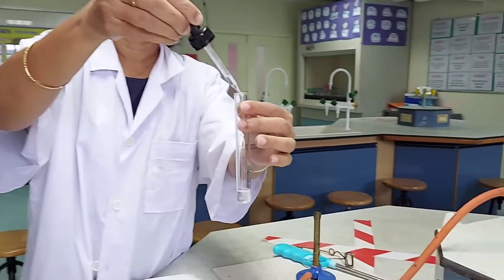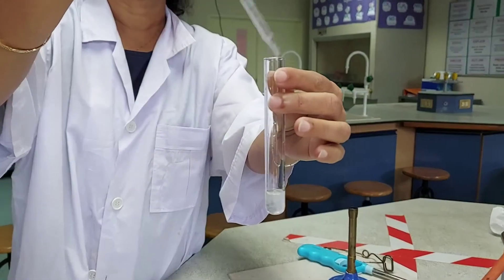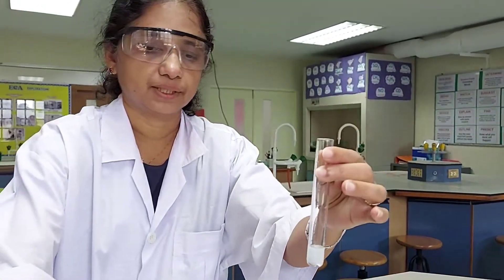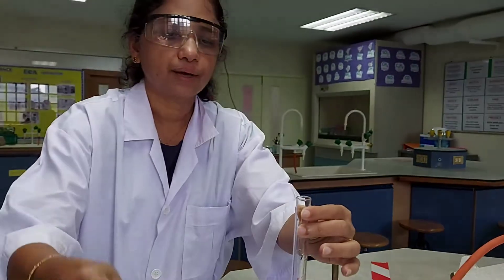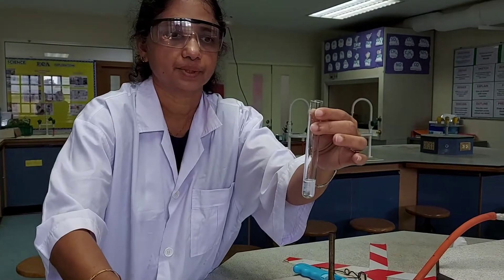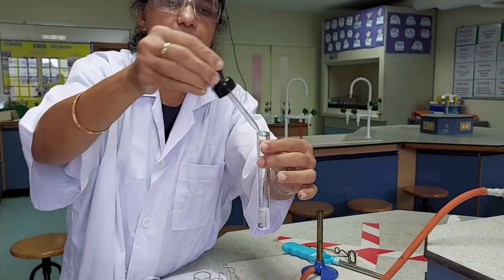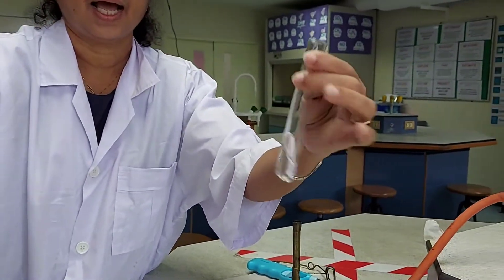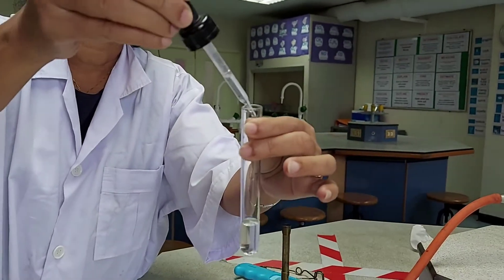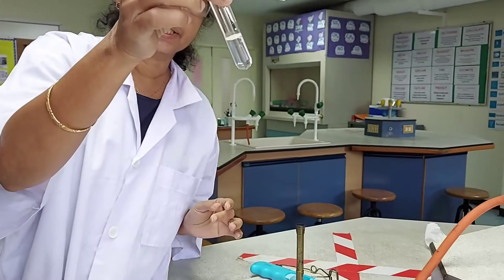As you add drop by drop, you can see a white gelatinous precipitate being formed. You have to add excess and see what happens to the precipitate — sometimes it remains, sometimes it dissolves. Here you can see that when I am adding excess sodium hydroxide to this solution, it is completely dissolving.